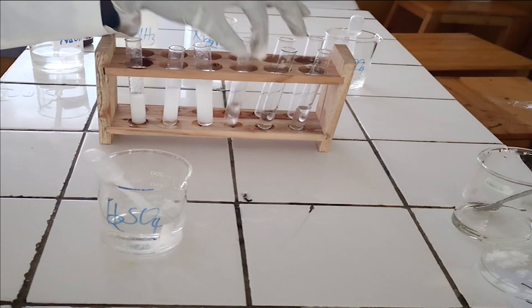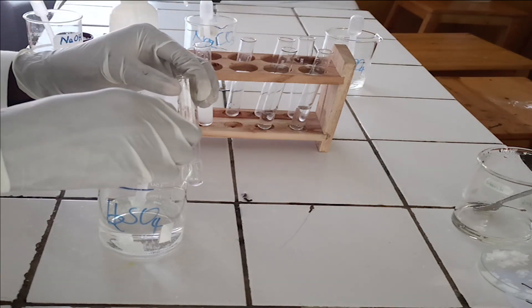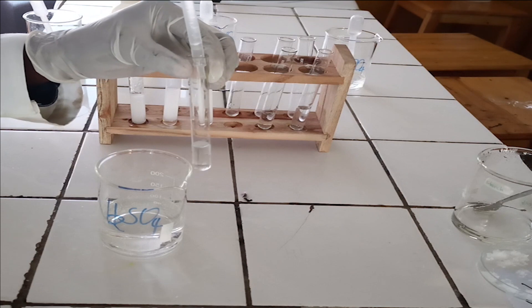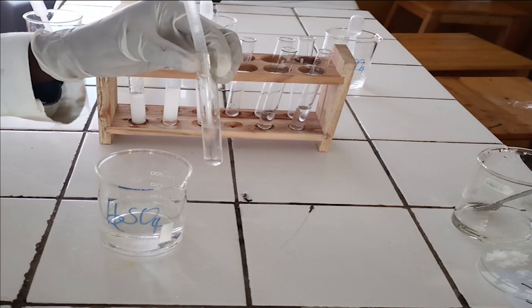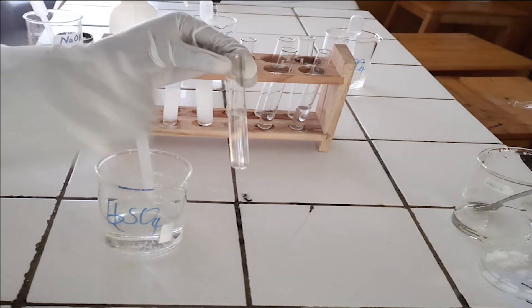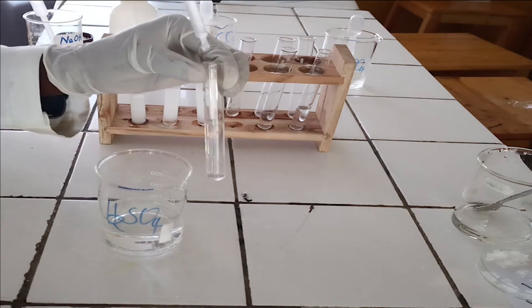To the fourth test tube, add diluted sulfuric acid. As you see, sulfuric acid does not react with magnesium ion.